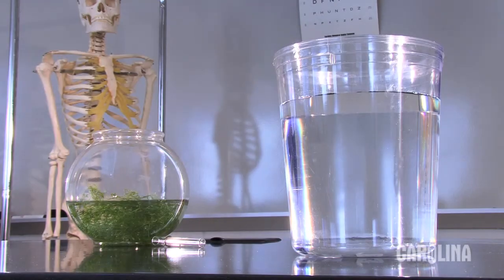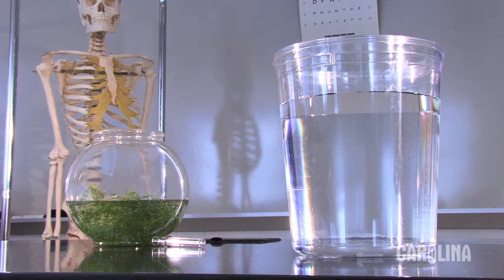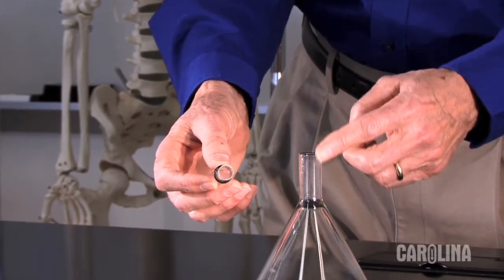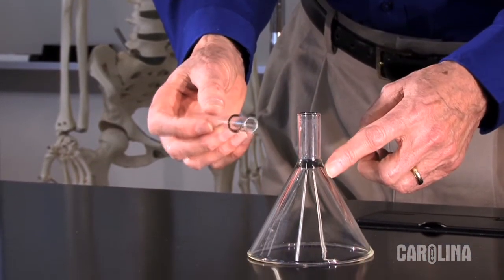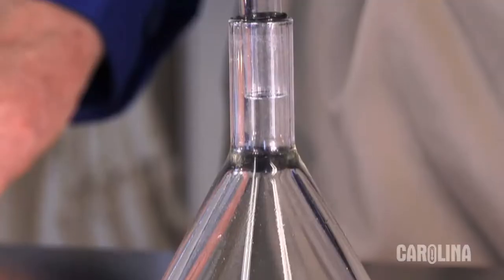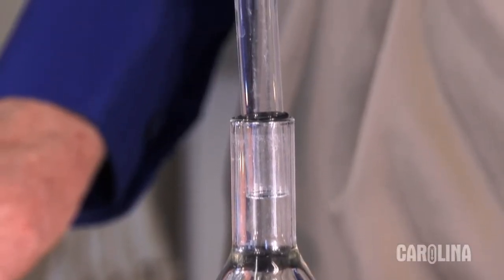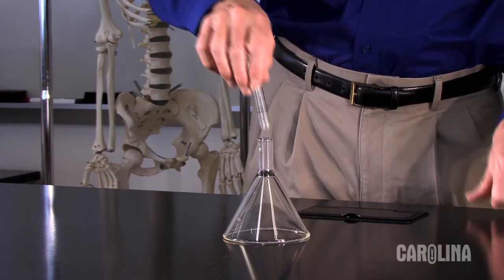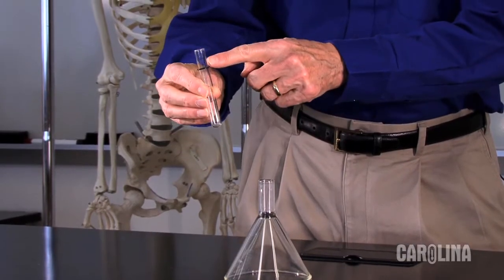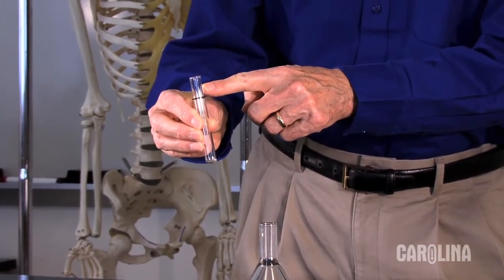As an option, I've added about a gram of sodium bicarbonate as a CO2 source. You'll need a funnel and a test tube that either fits over the stem of the funnel or just inside the stem like this one. This tube has a volume of 10 milliliters. The band will hold it in place.